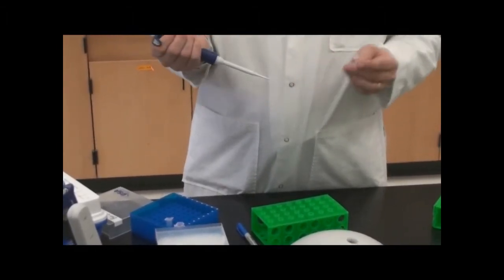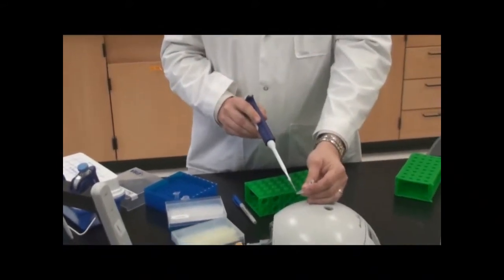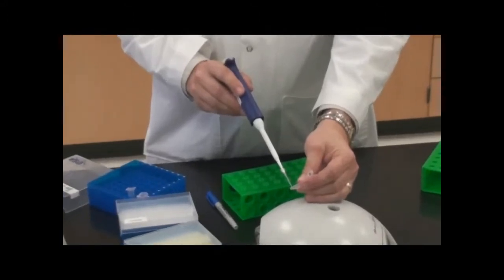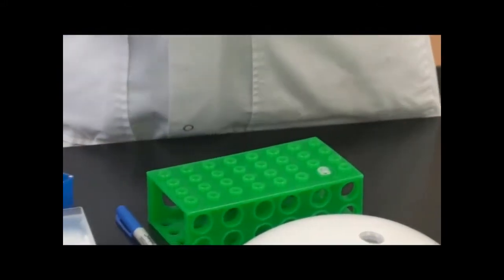And so you can see at the bottom of that tube, ten microliters is not very much. It's only coming up to about, there is the level of the fluid inside there.